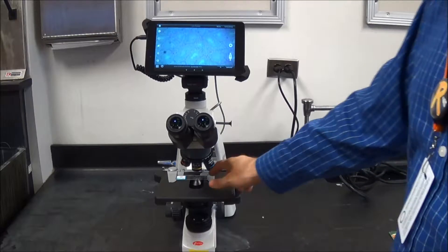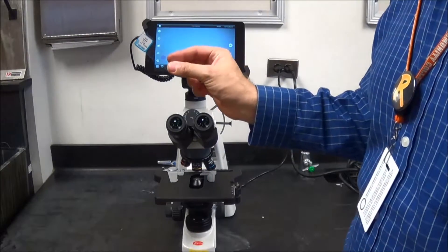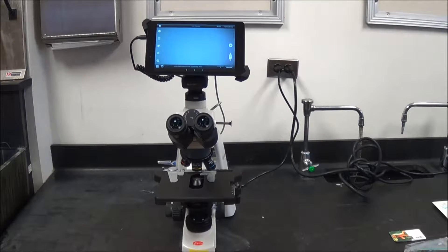Just as before, you want to tell your students to always put away whatever slides they have out. Take them off the microscope and put them back where they belong.